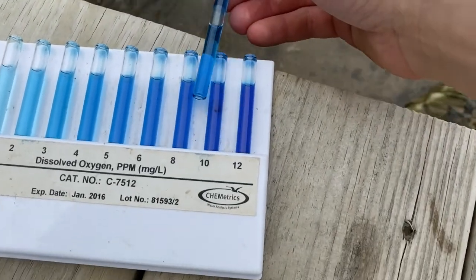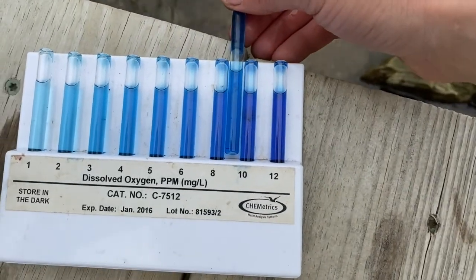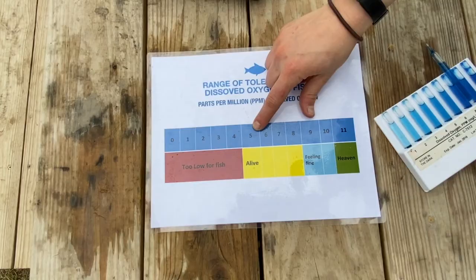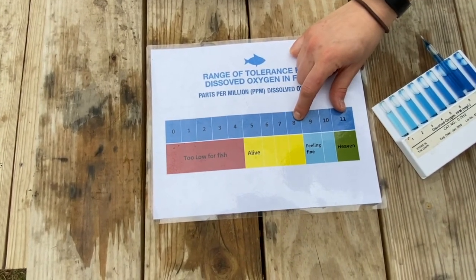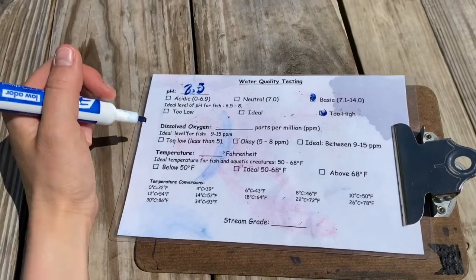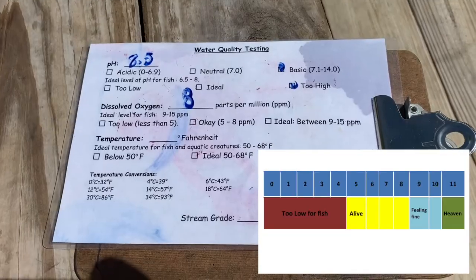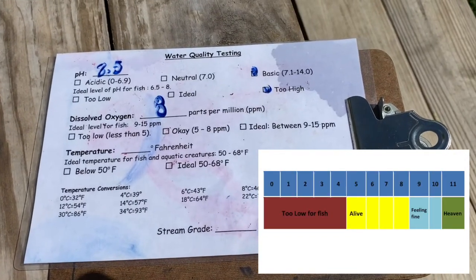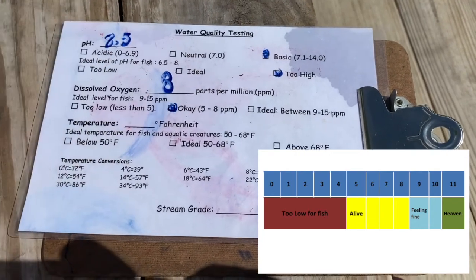I think it matches an 8. Well, 8 is above 'alive' and we're definitely at a good level for fish to live in Bullskin Run. So our dissolved oxygen level was 8. Fish need at least 5 parts per million to be alive, but the ideal range would be between 9 and 15, so it's an okay range but not the ideal range.